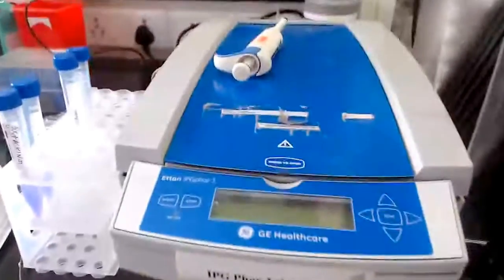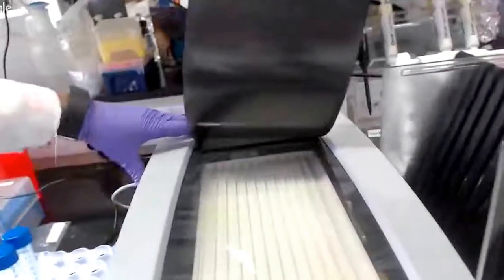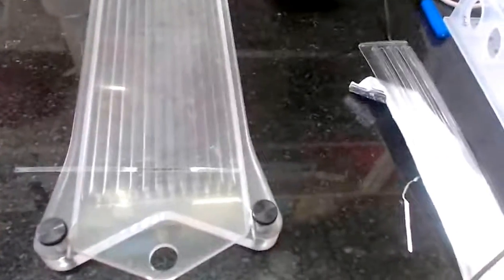What is involved in passive rehydration and active rehydration — once you have done rehydration you are ready for the next step, which is separating proteins in the electric field using the isoelectric focusing unit. We have the setup here. This is one of the instruments we use for isoelectric focusing — this is the IPGphor instrument — and this is where you insert and keep your IPG strip inside the tray.